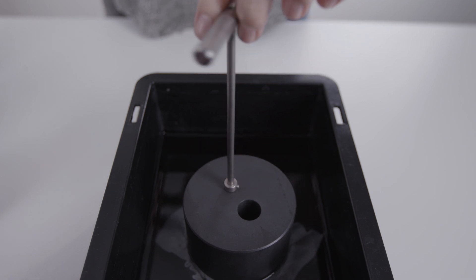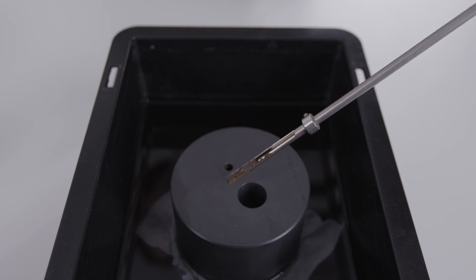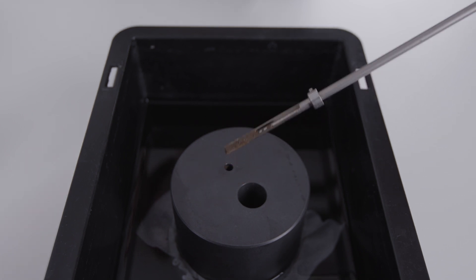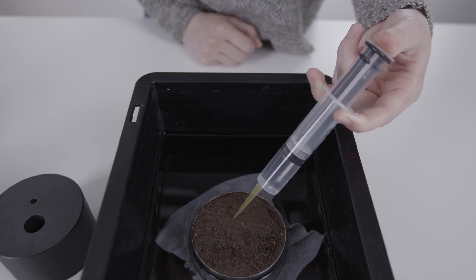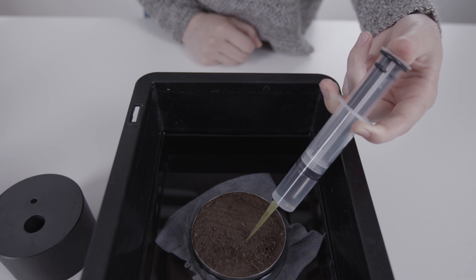Use the tensio shaft auger to drill the holes. Carefully and slowly drill in and make sure the soil sample is not compacted. Fill the drill holes with water to ensure air won't be pressed into the soil sample during assembly.